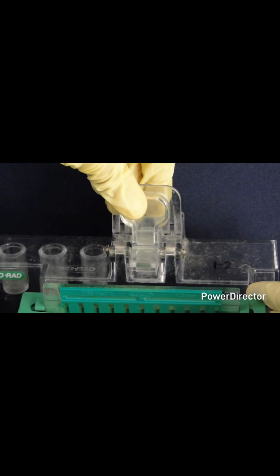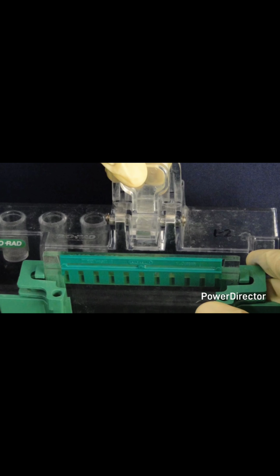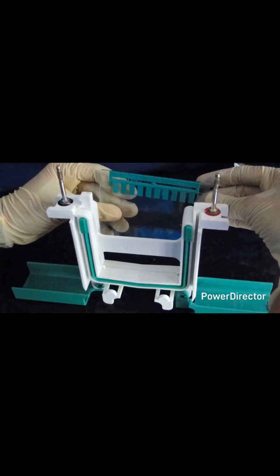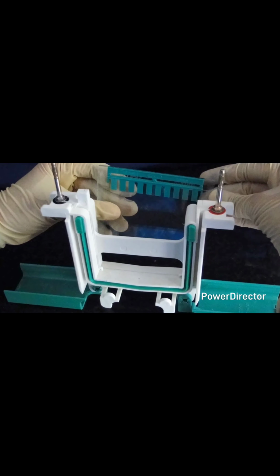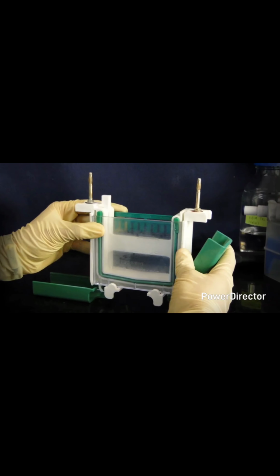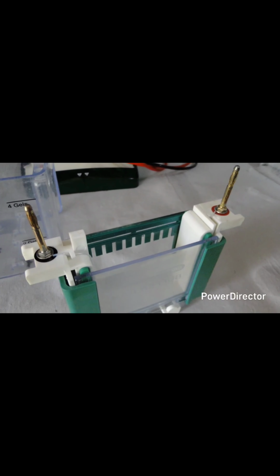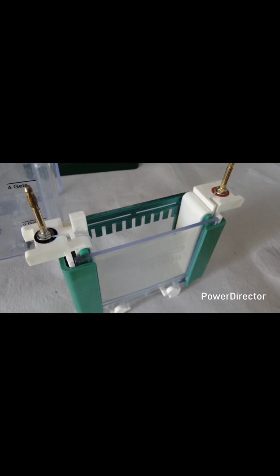Running the gel. To assemble, take out the gel first from the casting frame and clamp them in the gel apparatus, making sure that the short plate always faces inside, and if you have only one gel to run, use a dummy plate that is available to balance. Secure the plate, place them in the cassette and lock it. Afterward, place the cassette in the tank.